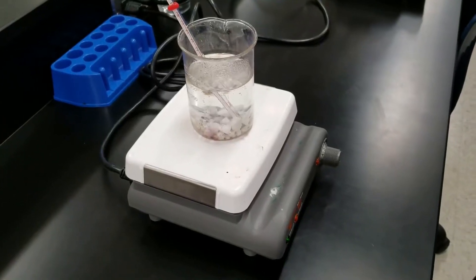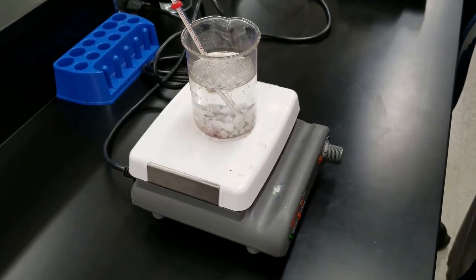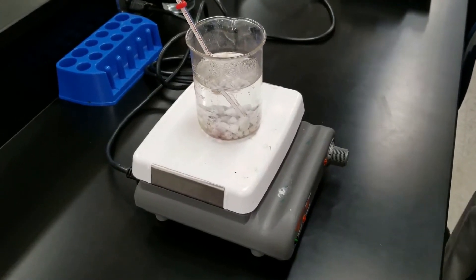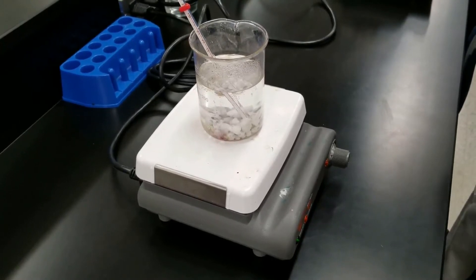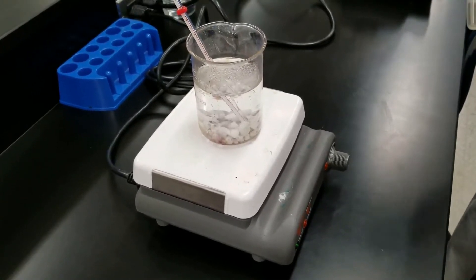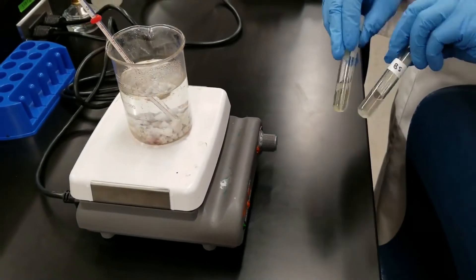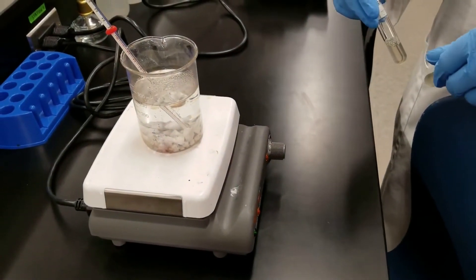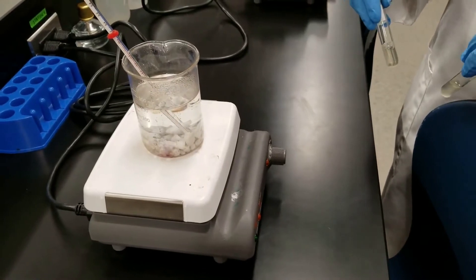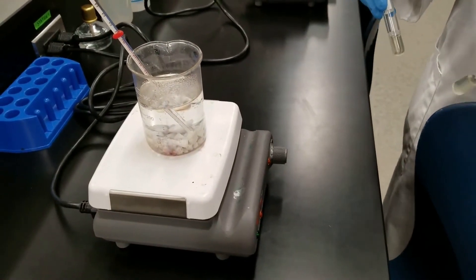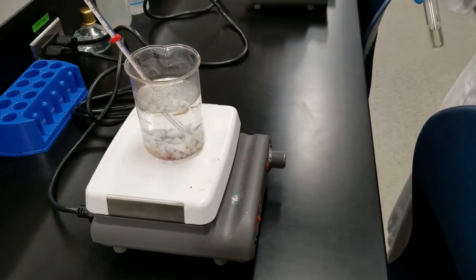We're testing the effects of temperature on the growth of bacteria. We have a plate that I've already inoculated for room temperature from these two broth cultures. One is Bacillus subtilis, the other is Staphylococcus aureus. It's at room temperature, inoculated, and we're going to incubate it now.